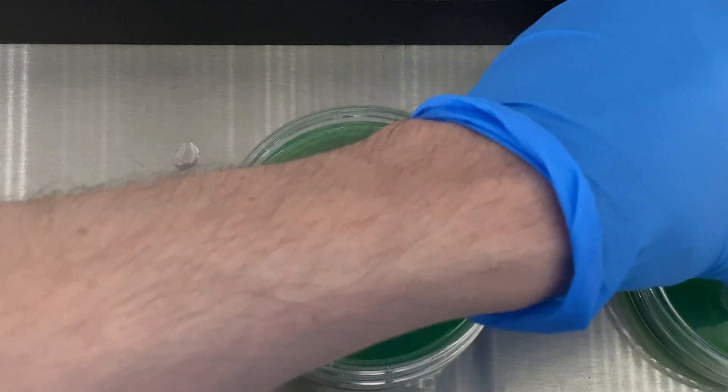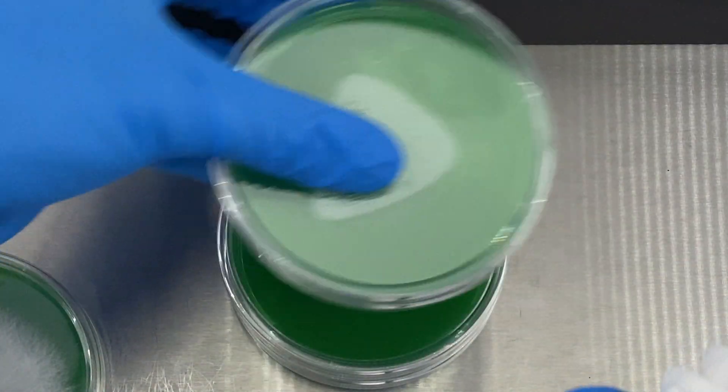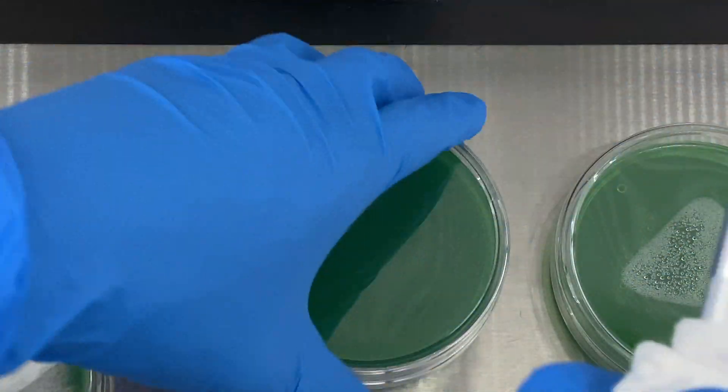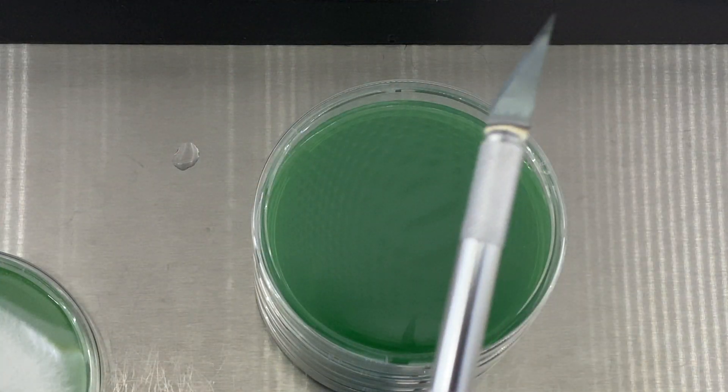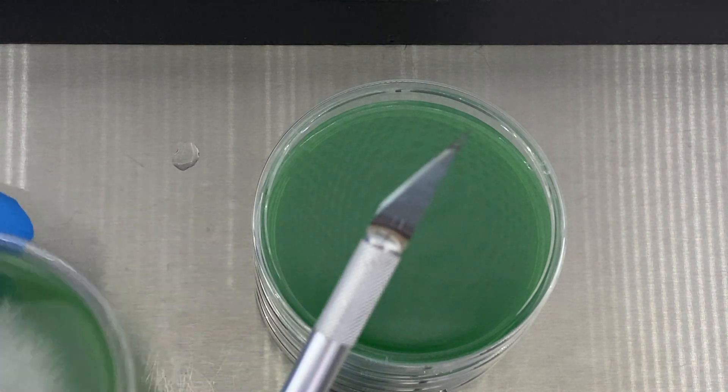Now I switch things around because I noticed that there was a little bit of condensation on that plate as well, so I'm going to be using another plate here that doesn't have as much condensation just for aesthetic purposes. But again, the condensation is not going to give too much of a problem.